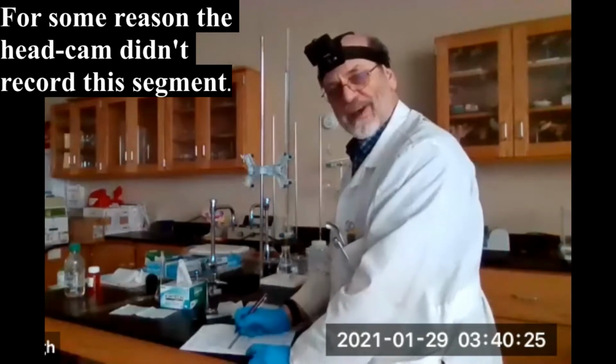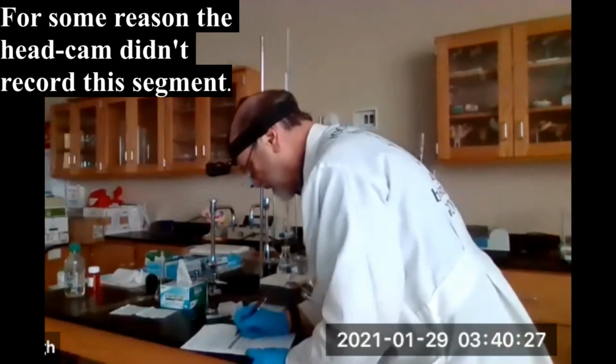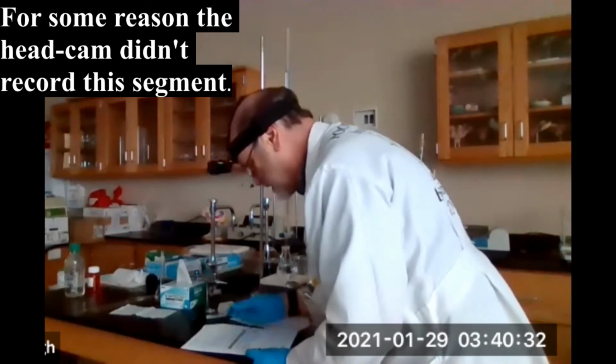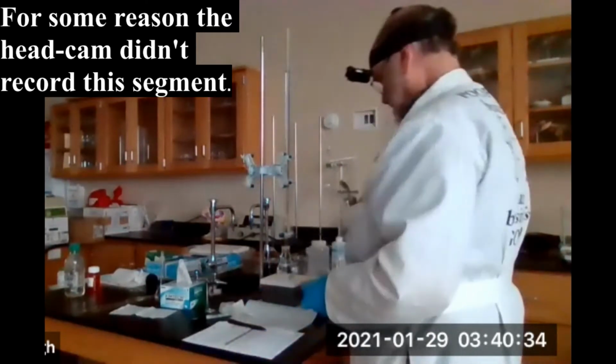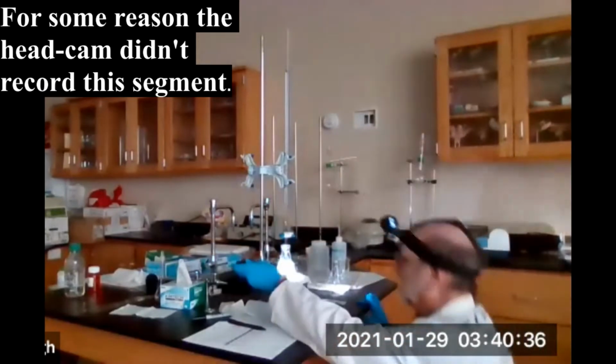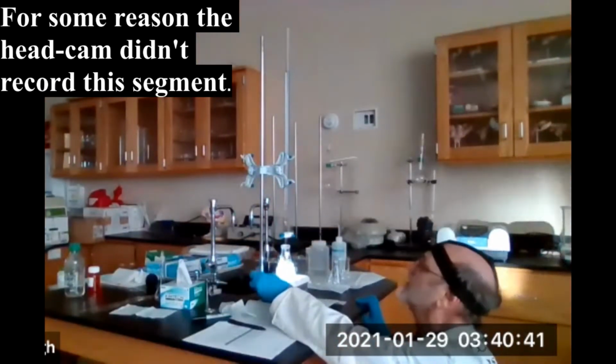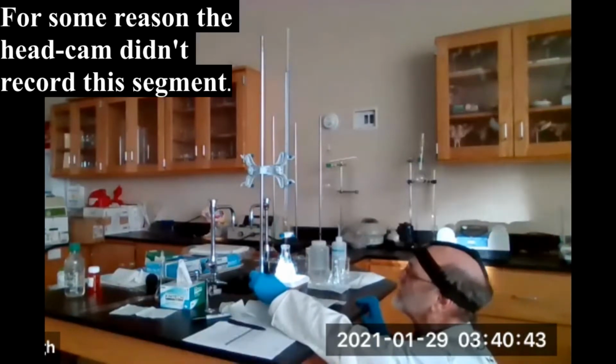Before it was 0.65. 0.70. Let's check it again. Yep, you can still see the light beam. See, I'm rocking it up and down. Hopefully the camera catches it.